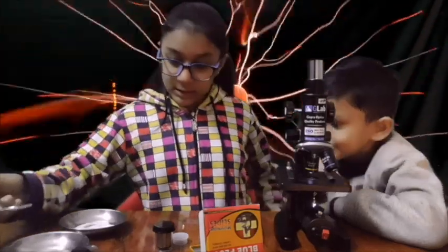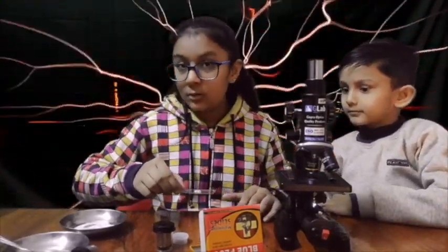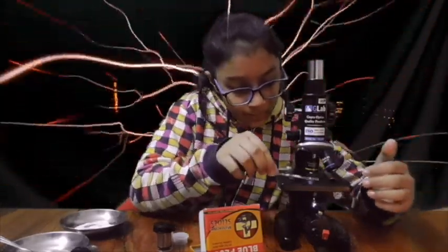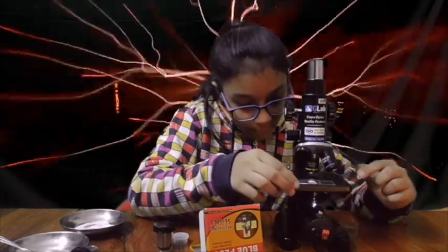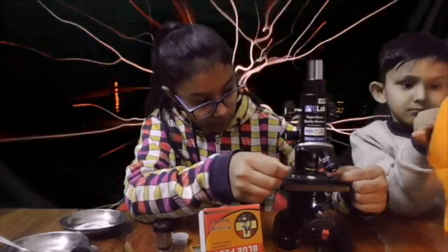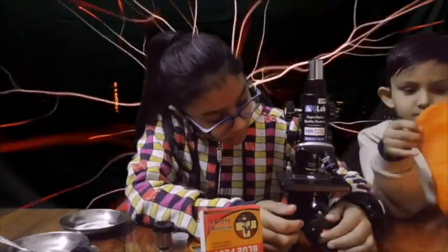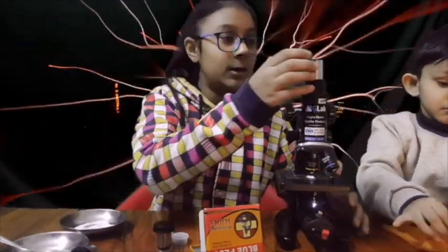Perfect. Now we're gonna put... what did I drop? Okay let's just continue. We're gonna put this slide here like that and put this on. Let's see.